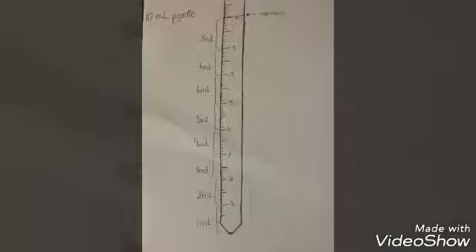For our first dilution, we're going to take 8 milliliters of our stock solution and transfer it to our volumetric flask. This is a close-up of how the 8 milliliter stock solution looks in the pipette. To dilute our stock solution and have a total of 10 milliliters in our volumetric flask, we're going to transfer 2 milliliters of the blue solution, or the water solution, into the volumetric flask with the stock solution.